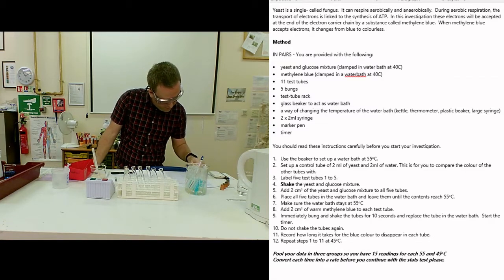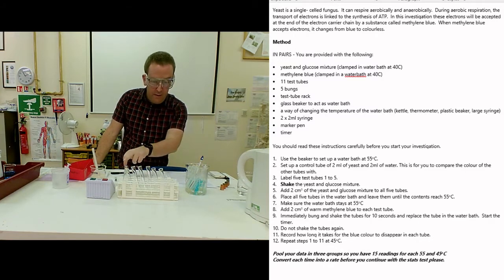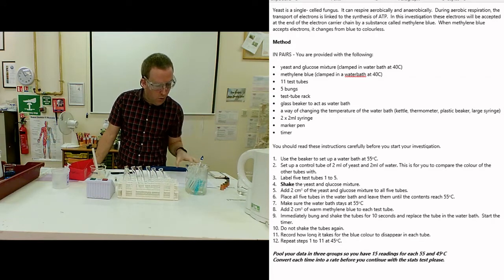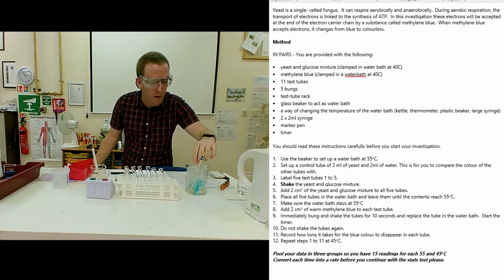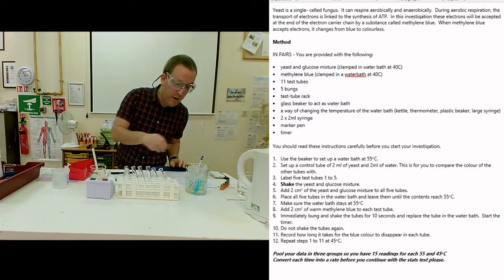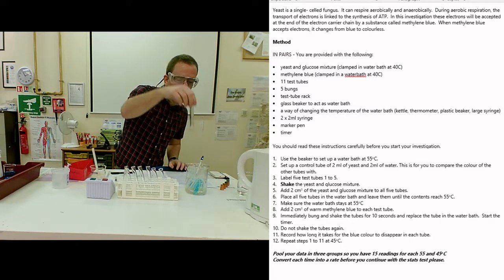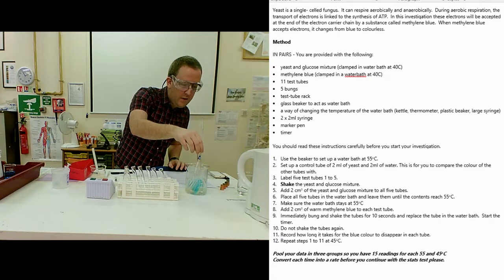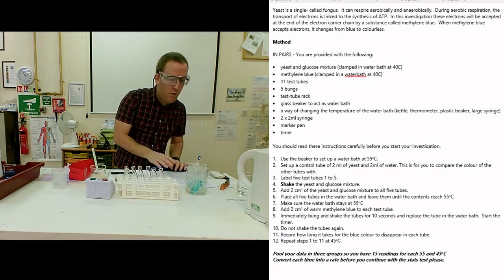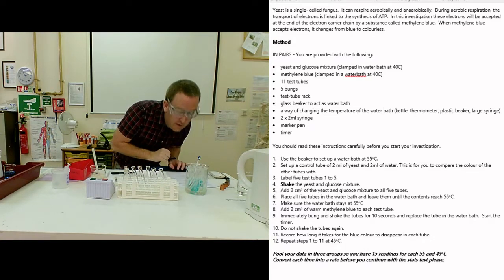Once I've done that five times, place all tubes in the water bath. Now I've already done that in true Blue Peter fashion - here's one I made earlier. We've got tube number one with our yeast warming up, which should be at the same temperature as the water bath, 45 degrees C.